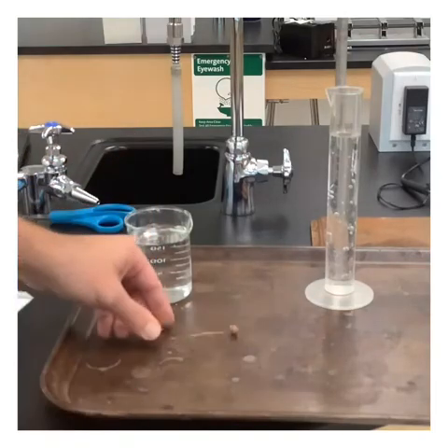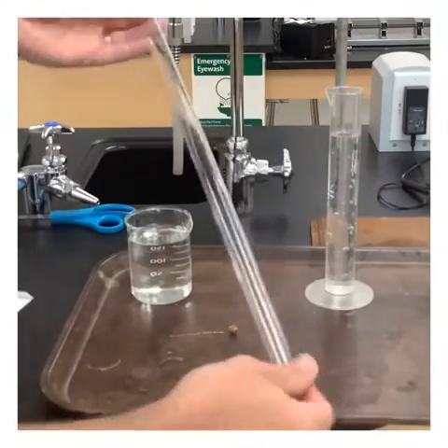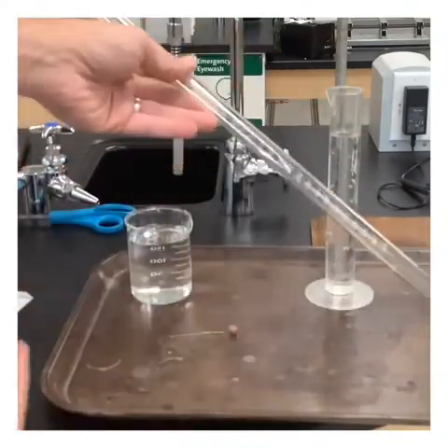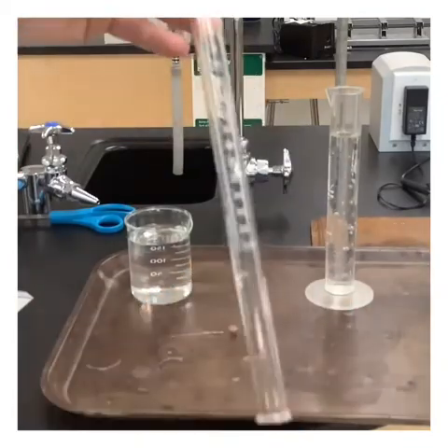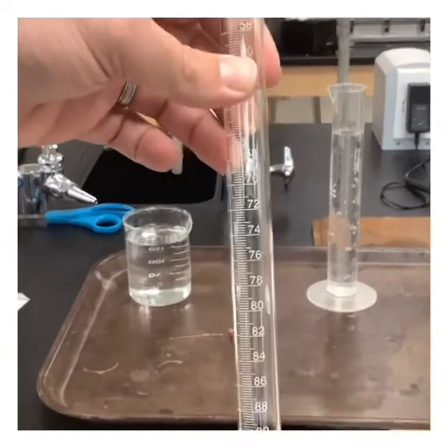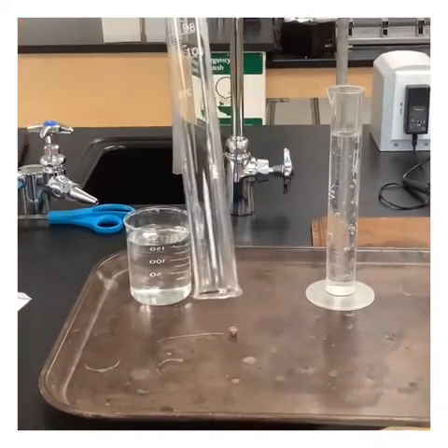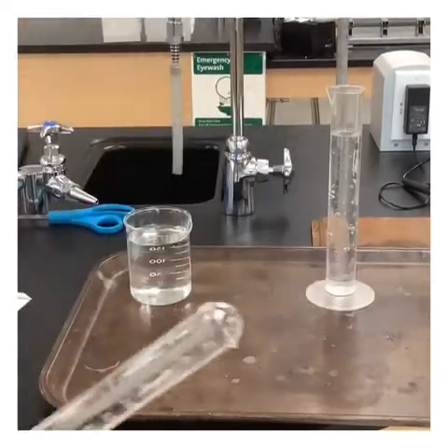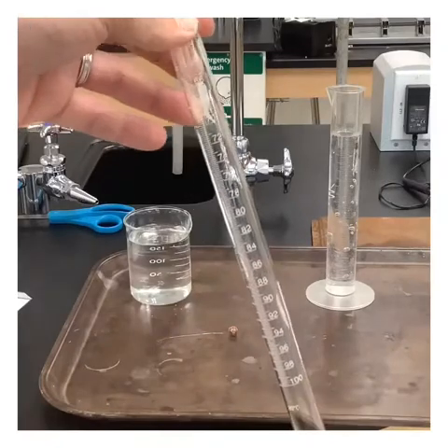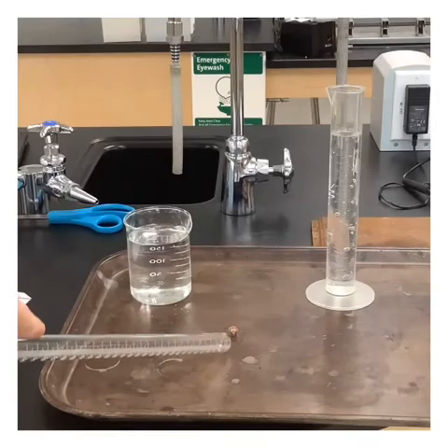And so the way that we're going to do this is we're going to use something called a eudiometer. So it's like a large test tube, it's almost like a burette, if you remember burettes. So we've got, if we look at this, it's got increments on it. See if I can get this to focus. There we go. So we've got increments, so it's through 100. But this end is open like a test tube. It's basically like a test tube. It's closed on this end, and we don't have a valve over here. So I'm going to fill this with water. But I need to get this to react.